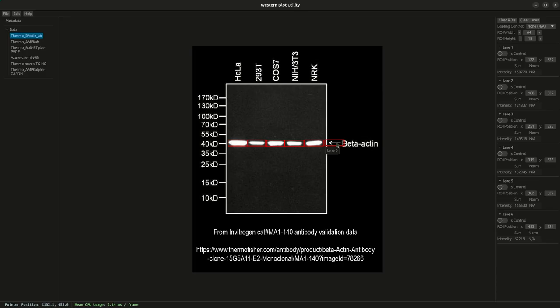And on the end, let's get into one of the first actions you have, which is delete. So there are a few ways to delete, but the easiest way is to right click and delete an ROI. At any point you can undo that. This application supports undo and redo, so I'm just going to undo that to now demonstrate that I can click the delete button and I can also remove the ROI. You'll notice here, and it's important to call out, that the ROI is removed, but the lane is not.